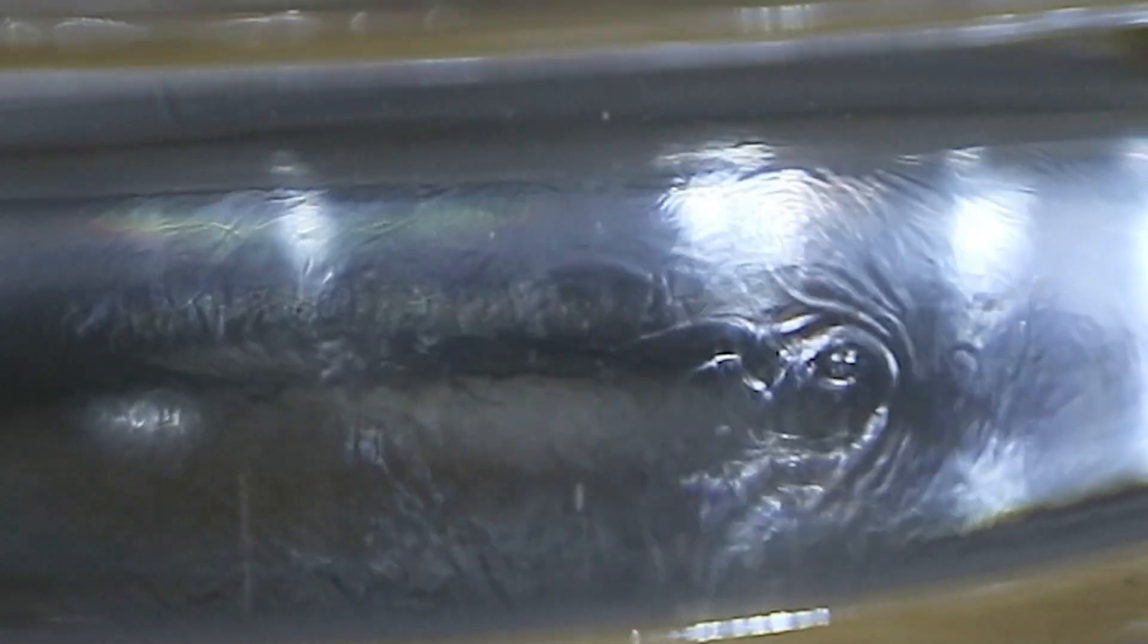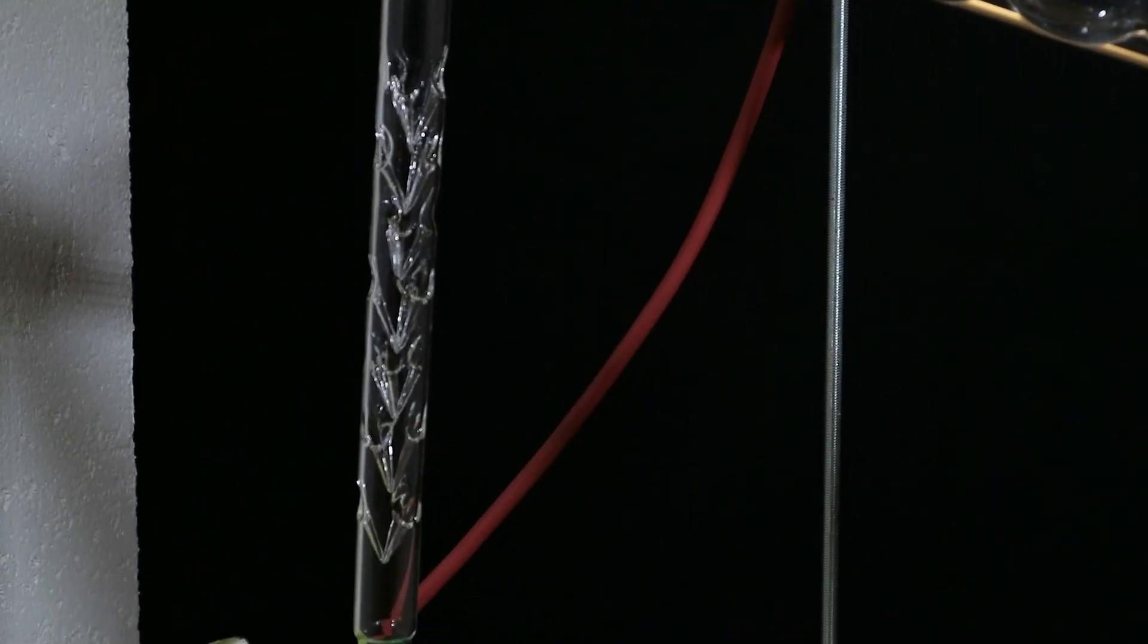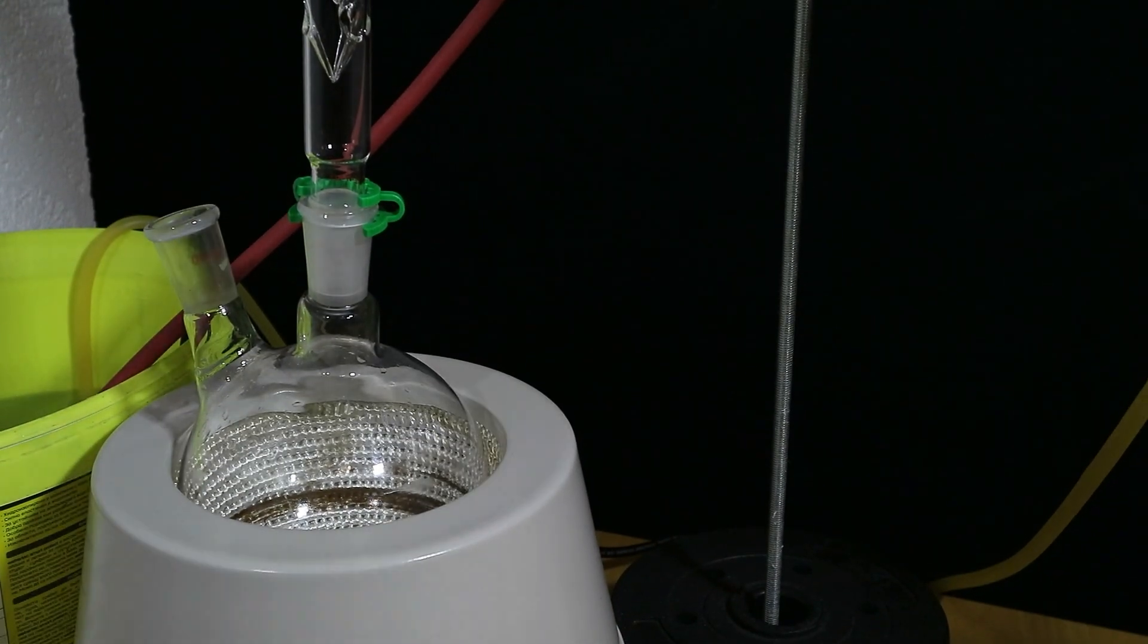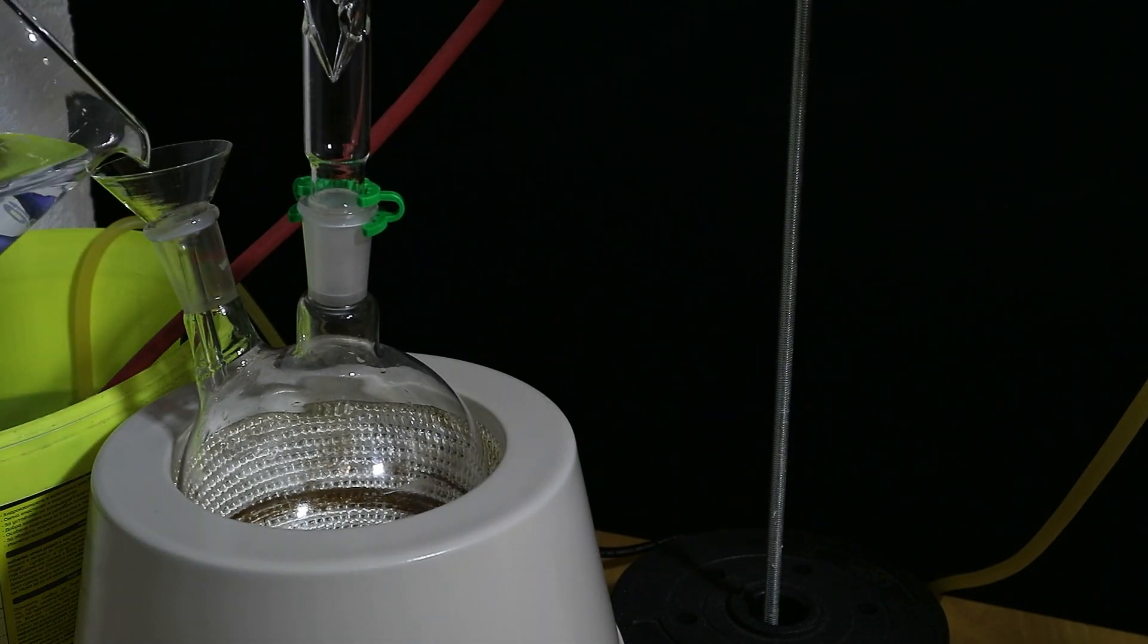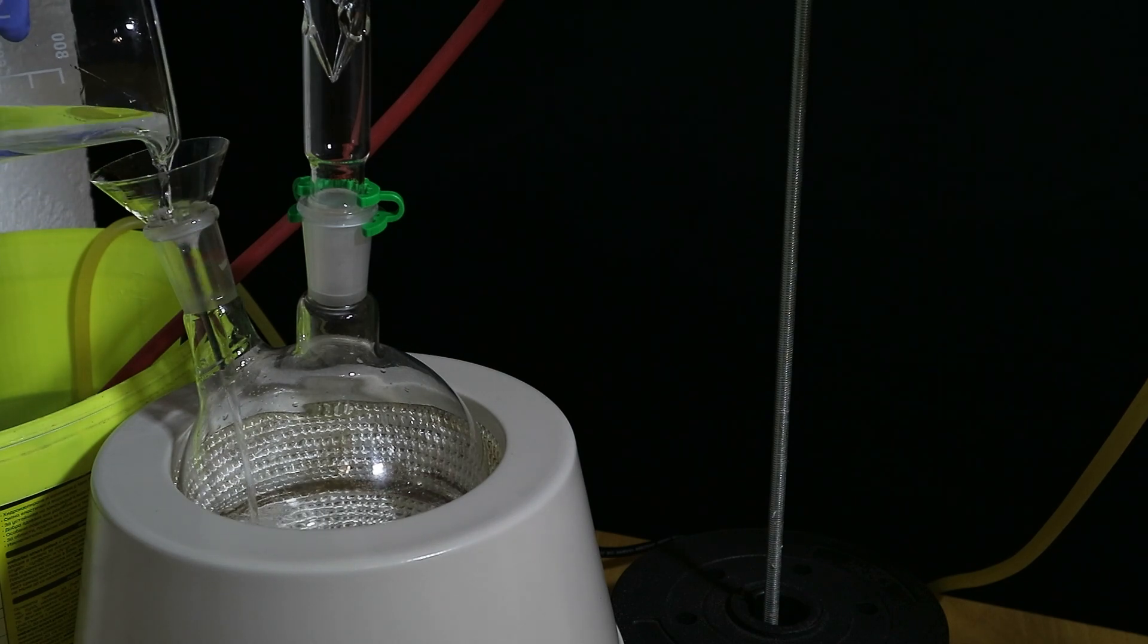Okay let's keep going. I am now setting up the second distillation and this one we're going to achieve a much better separation between the ethanol and water. We still have some aroma in the mixture but it's not very strong anymore.